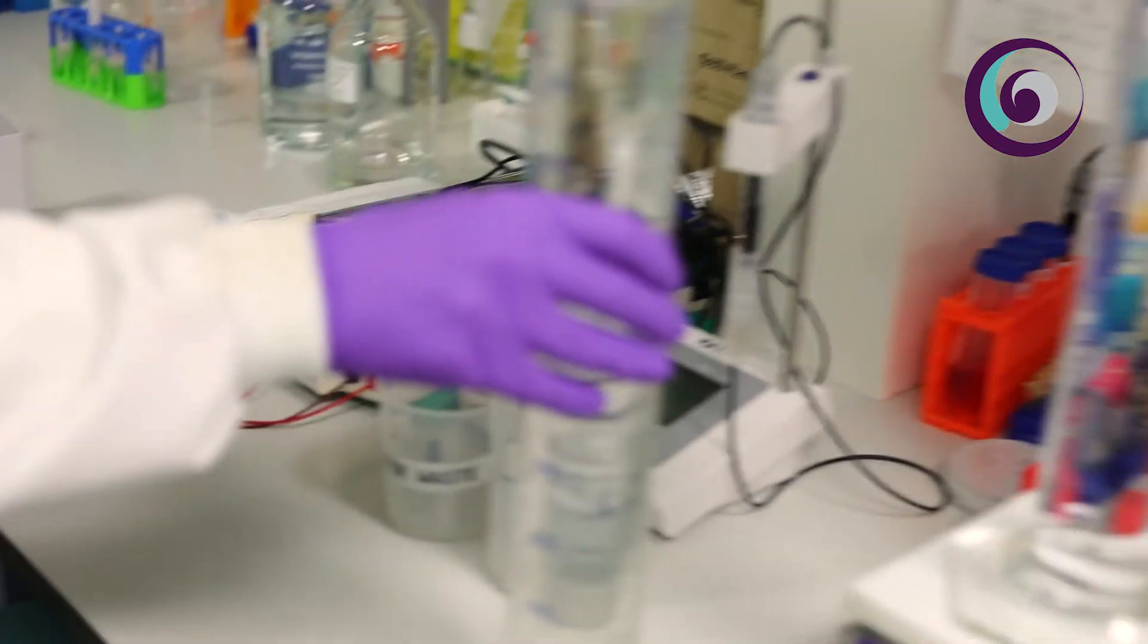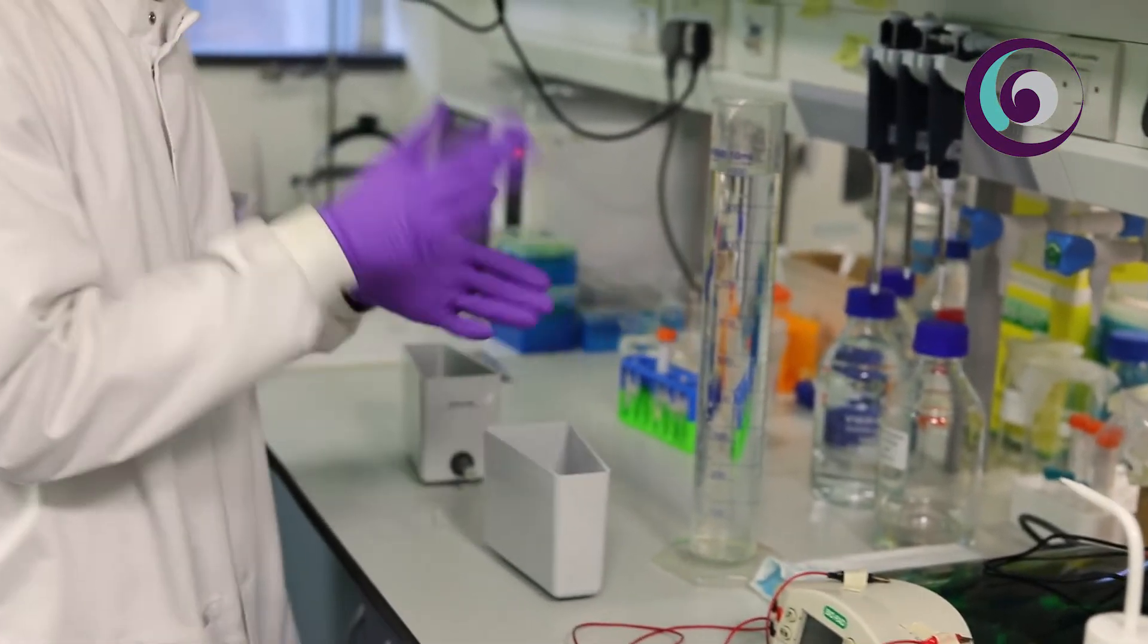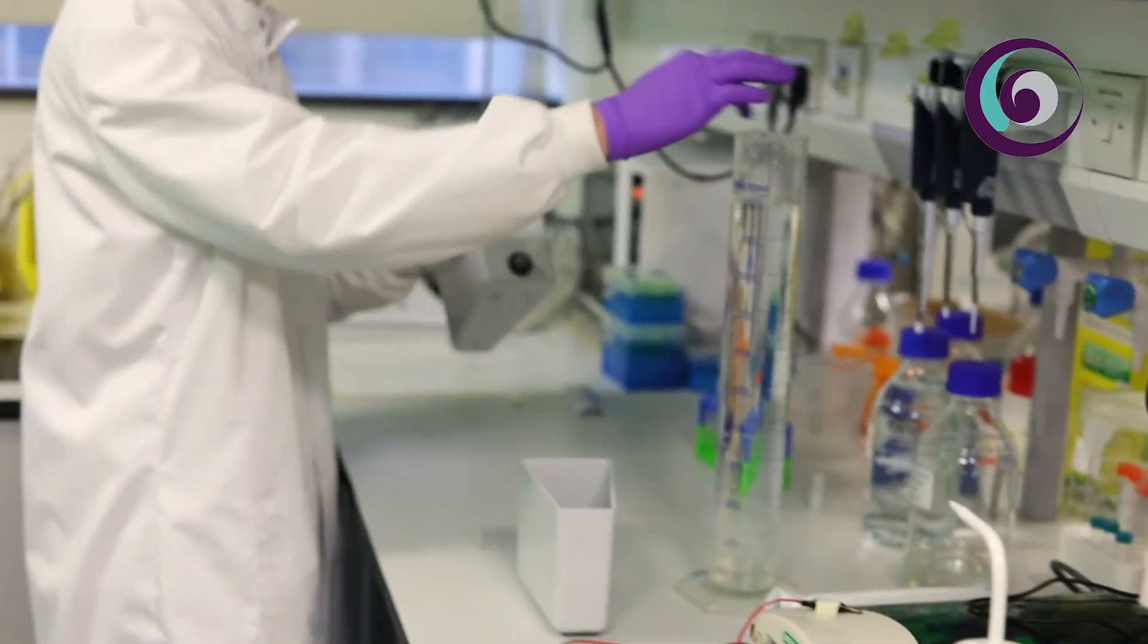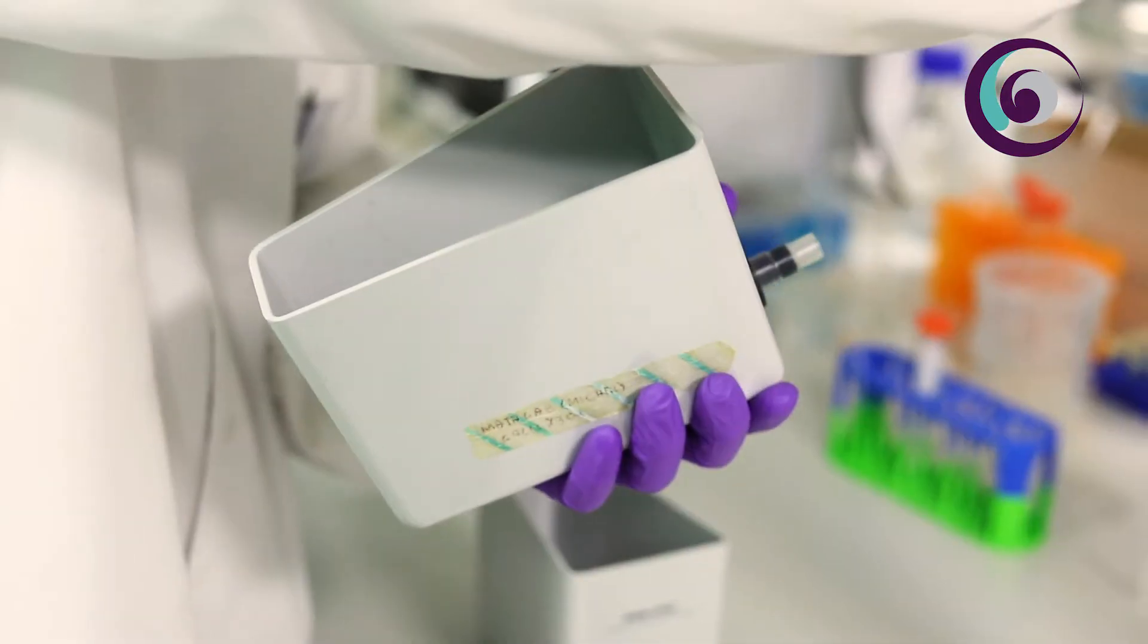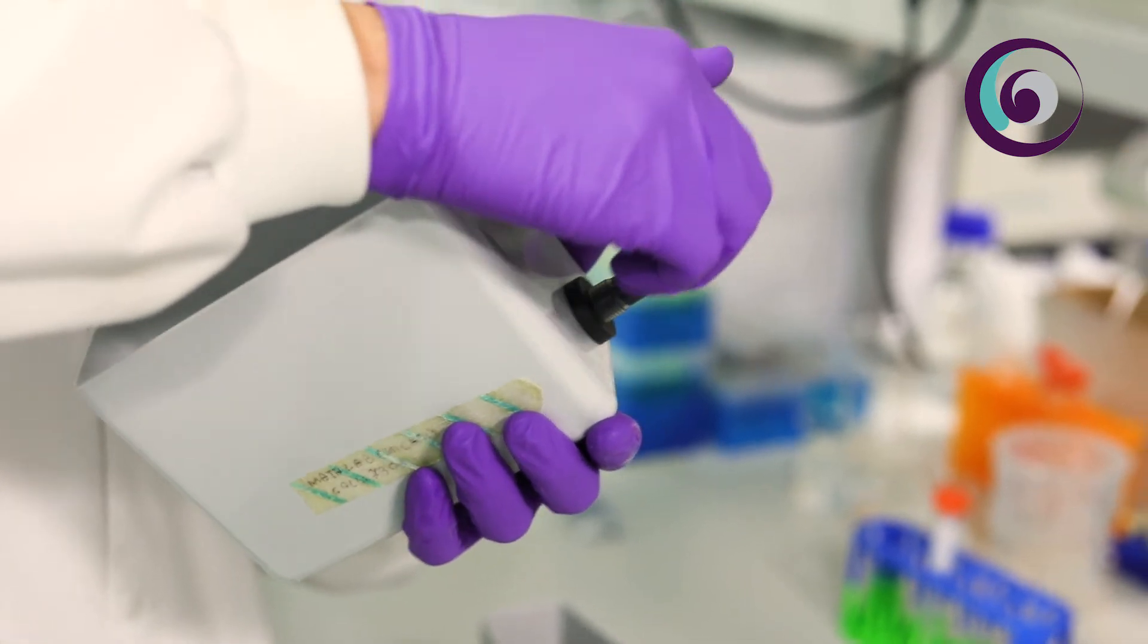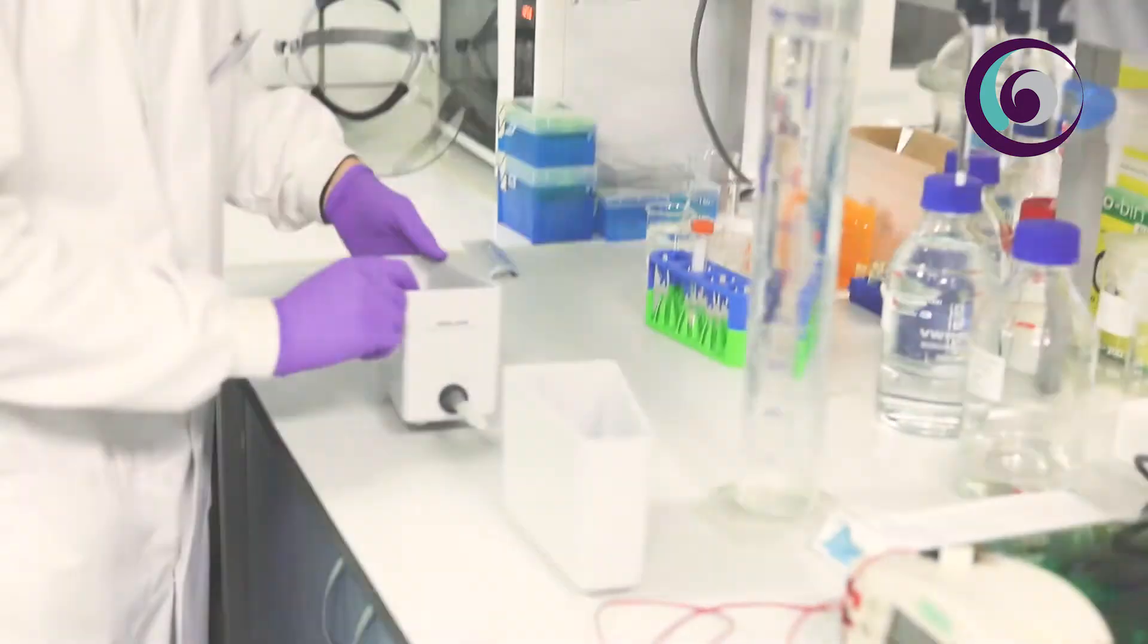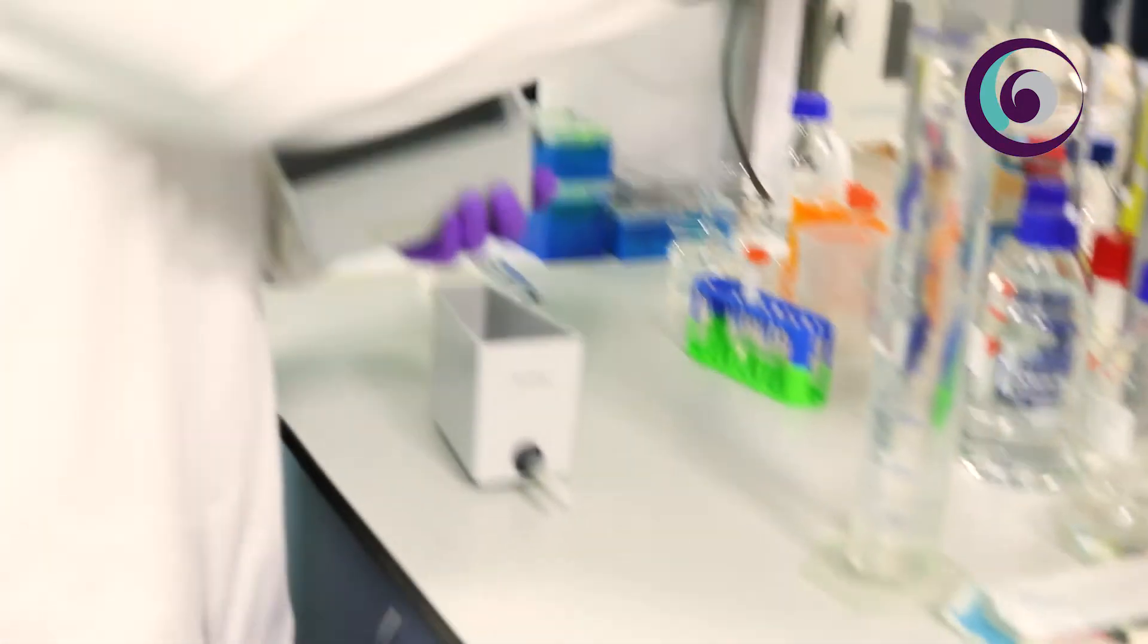What we do is with the same buffer we just wet a little bit the tubing of the buffer containers to help us to grab the capsule in this tubing. Now what we have to do is pour the buffer. I poured half liter of buffer in each container.